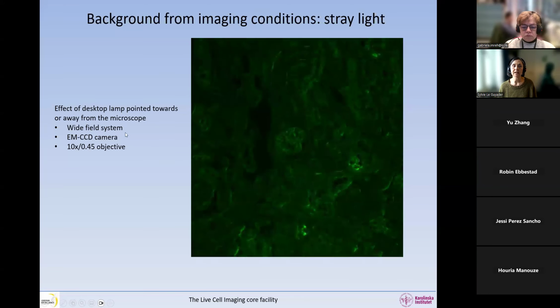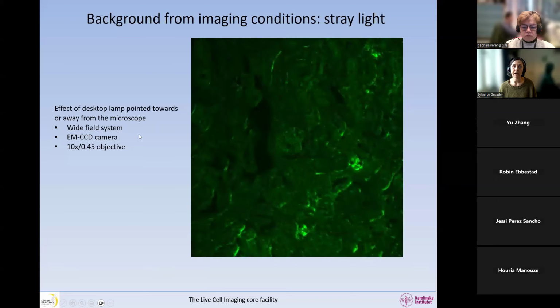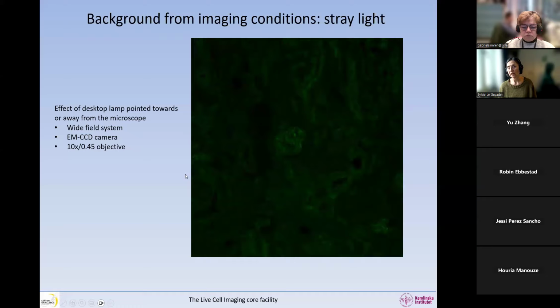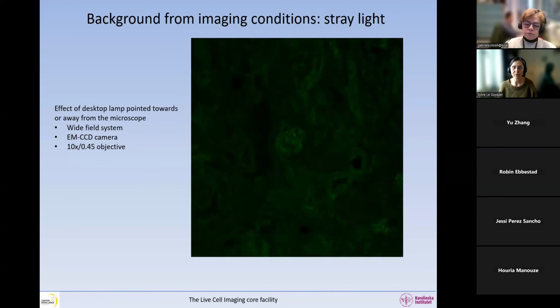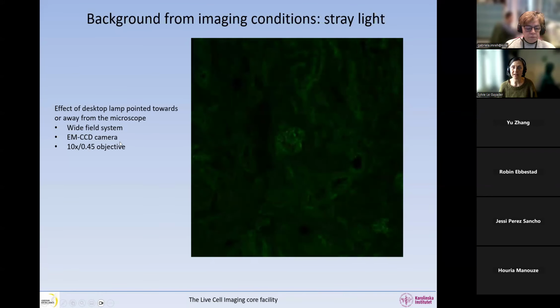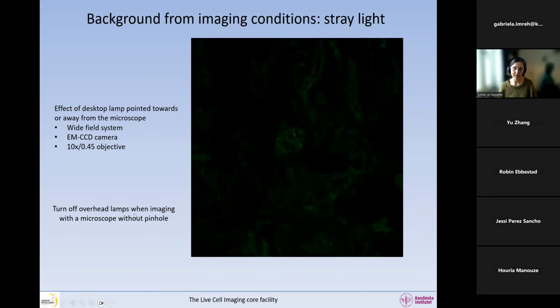And this is visible in a system that does not have optical sectioning, because clearly on a system that does optical sectioning, you're going to throw away the light that comes from the out-of-focus plane, and the light from the desktop lamp is out of your focal plane, so this light will be thrown away. But here we have a wide field system with an EM CCD camera, so a very sensitive camera, and this objective, we are seeing the desktop lamp. So turn off the overhead lamp when imaging with a microscope without a pinhole.